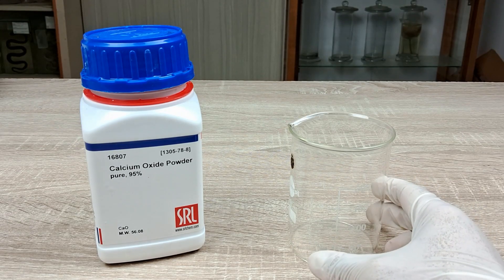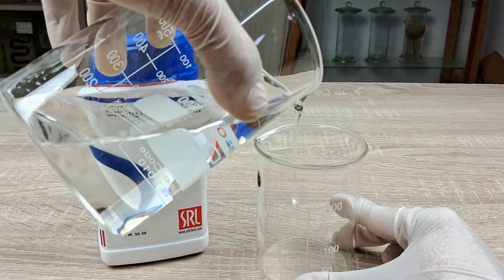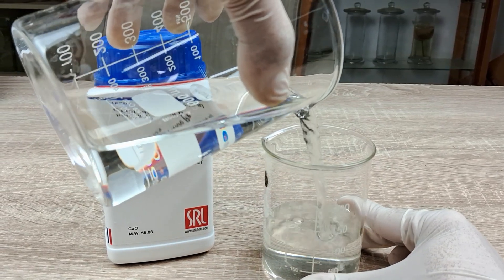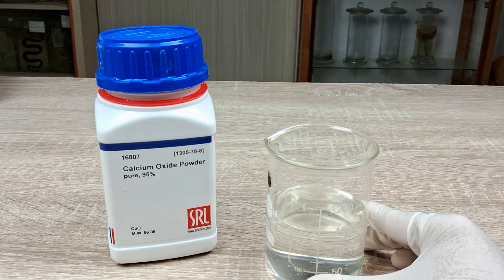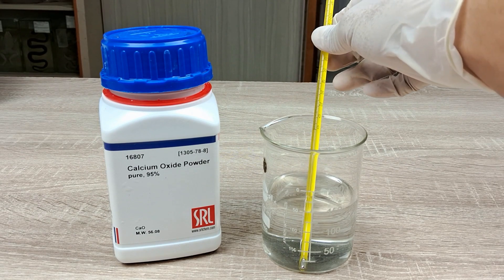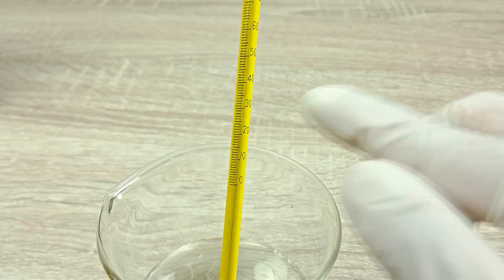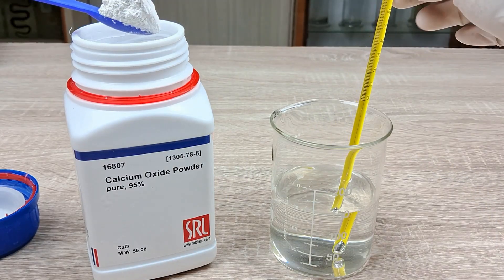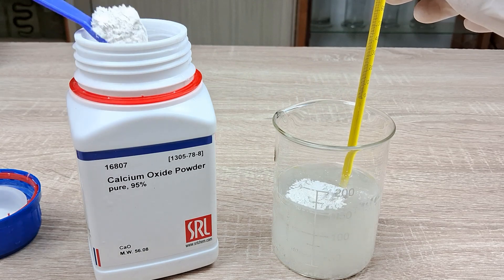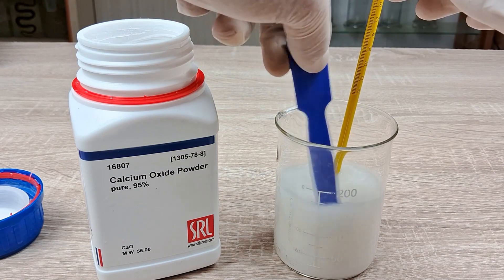To perform this experiment, take the 250 ml borosilicate glass beaker and fill it with approximately 100 to 150 ml of water. Introduce the laboratory thermometer and record the temperature of the water. Now add a few spatulas of calcium oxide to the water in the beaker and stir briefly. Wait a few seconds for the reaction to commence and then record the temperature of the solution again.